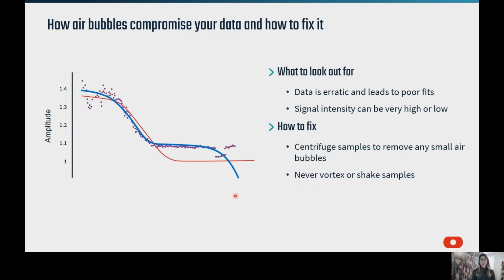Air bubbles are going to be another thing that can cause anomalies in your ACF. So if an air bubble is present, the raw data is going to jump around. We can see this here in the purple data points. It's very erratic, so it's going to lead to poor fits as well. The signal intensity might be very high or low depending on where in the air bubble the measurement is being read. And there might also be an increase in the scattering intensity for a single acquisition compared to other acquisitions for that particular sample. So some things to fix air bubbles are to centrifuge your samples prior to loading to remove any small air bubbles, as well as not vortexing or shaking your samples prior to sample loading or measurements.